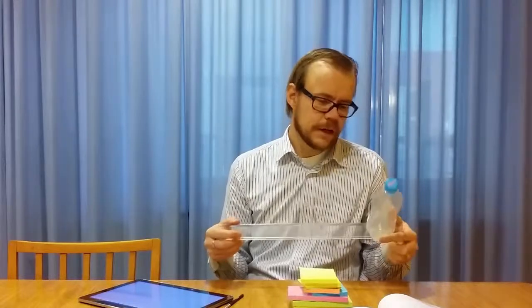What I will talk about now is artifacts. When you have this scanning machine, the first problem that occurs is, I told you in the scanning tunneling lecture that we use piezoelectric ceramics to control the motion of this. And there's one drawback with using piezoelectric ceramics, and that is that it has a hysteresis to it.